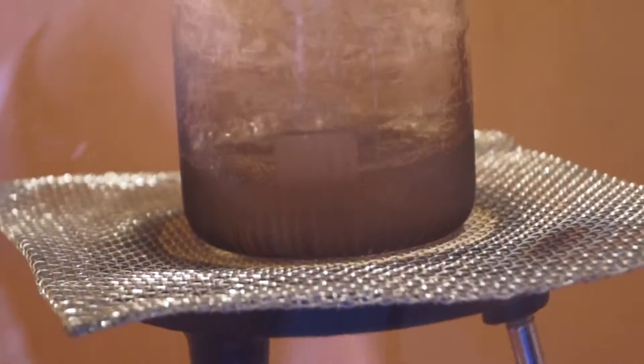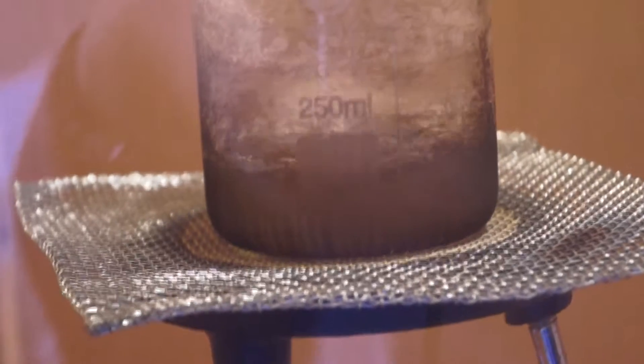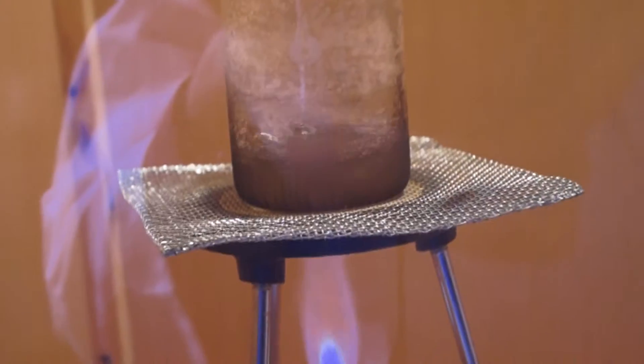When crystals start to form on the surface of the solution immediately remove the beaker from the heat and decant into a conical flask.